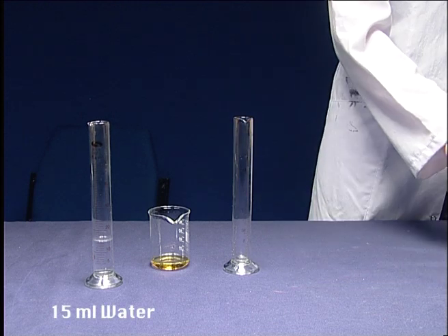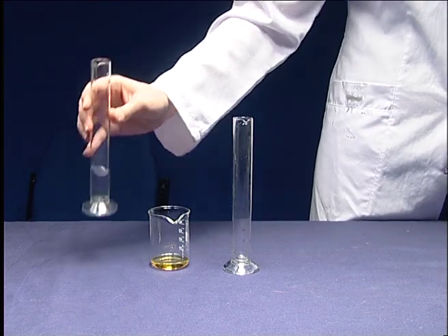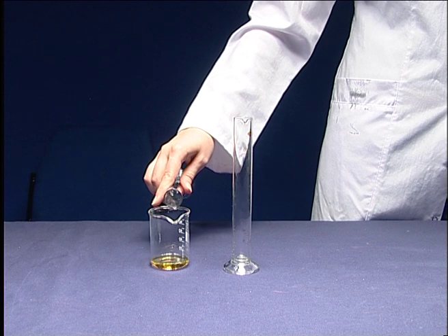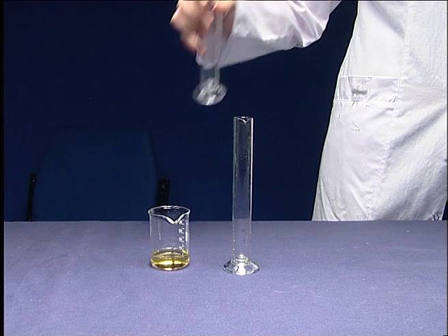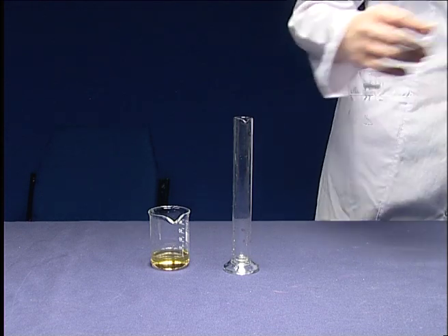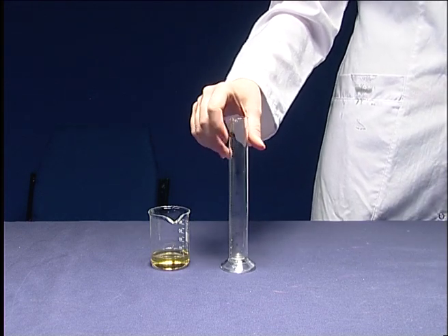Then add 15 ml of water to replace this solution. Do the same procedure for all the test tubes.